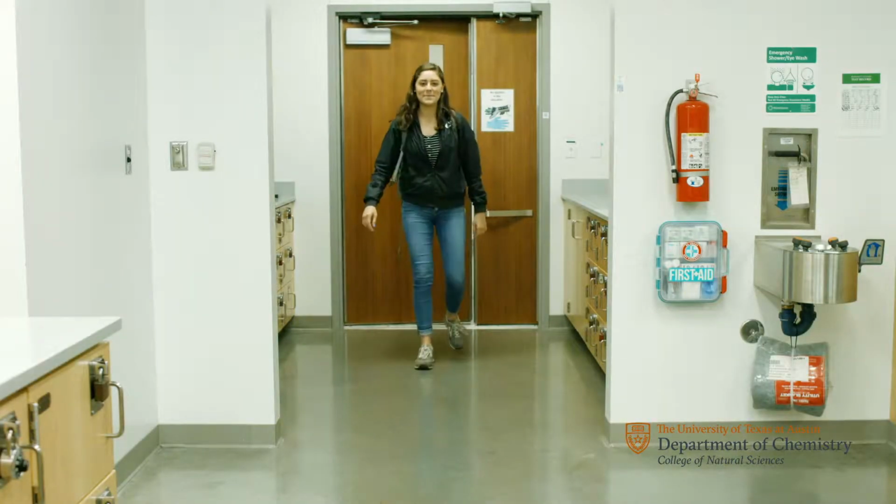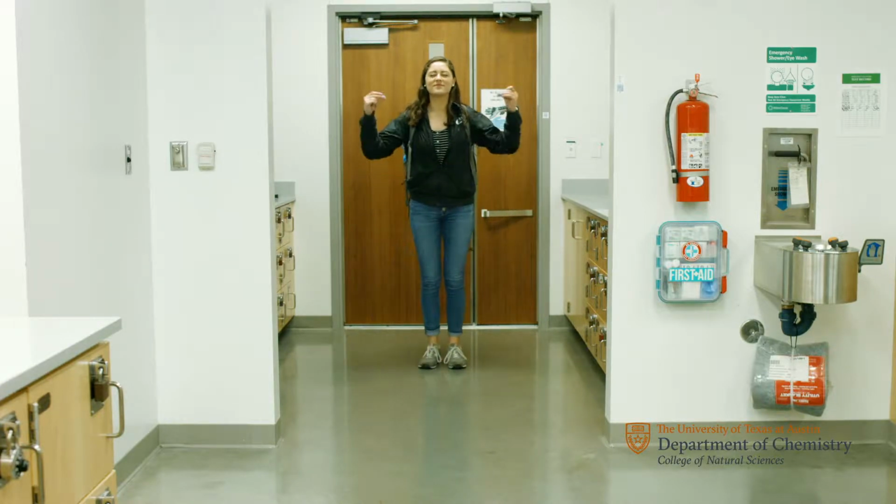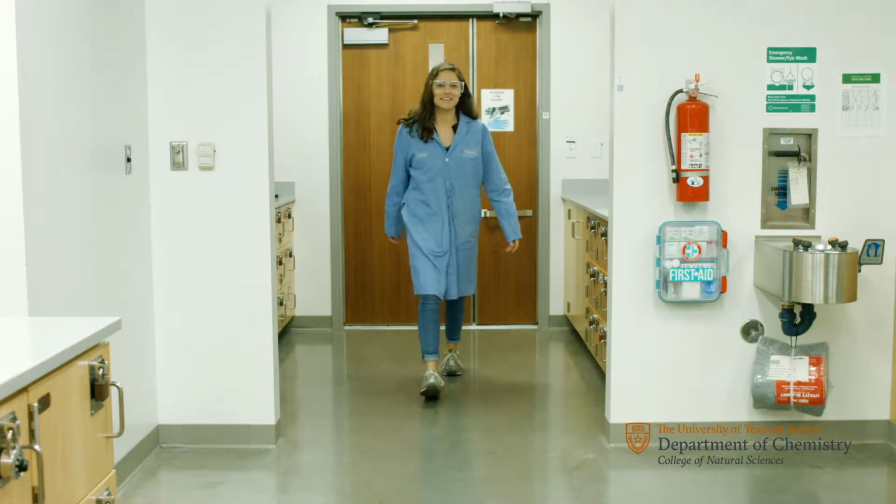Please remember to obtain a lab coat and goggles when you enter the lab. Now follow the yellow brick road, Camila.